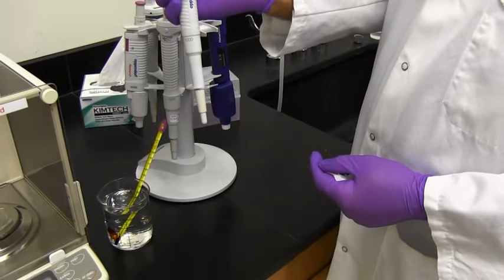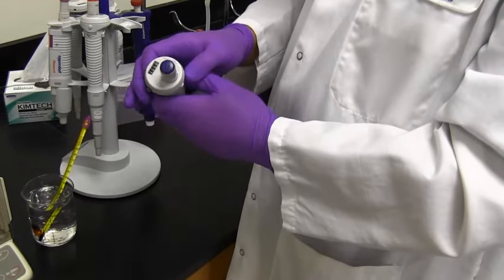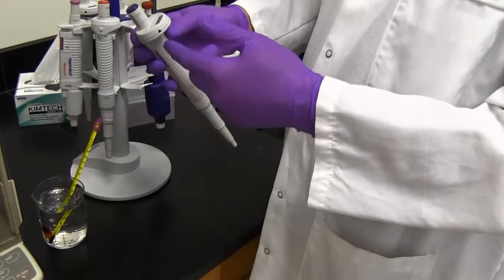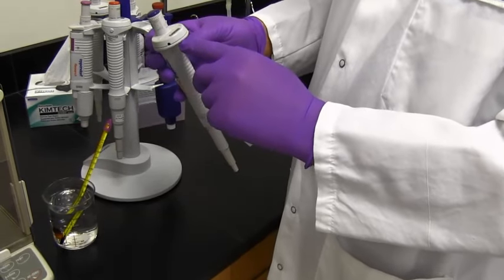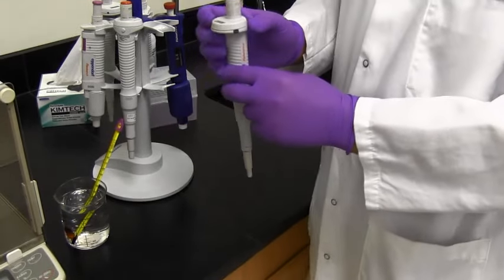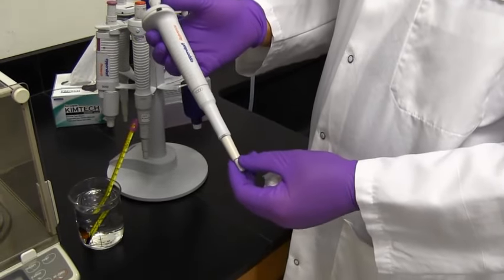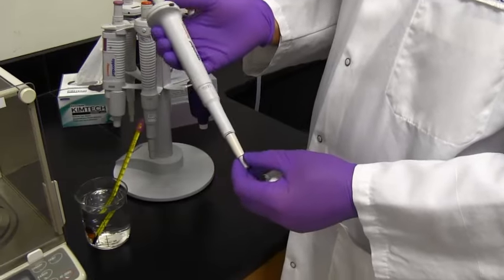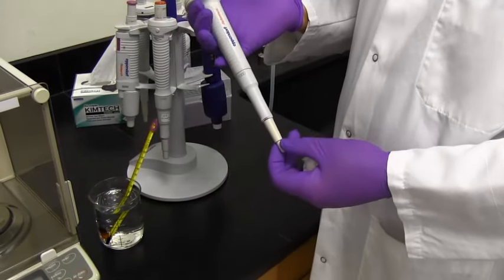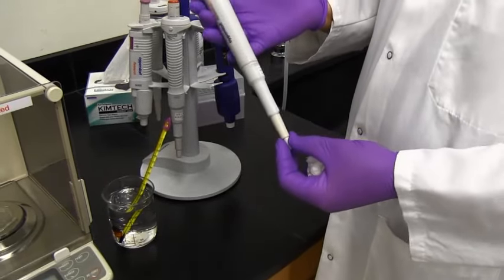It's loose. So it's got enough lubrication on the o-ring. Otherwise I have to lubricate more. Before calibration I got to see if I need any adjustment. There is a knob for adjustment. I can use the knob. I can turn it clockwise or the other way around to get it to the calibration weight I needed. I usually like to 100% accuracy. But our spreadsheet allows 5% deviation. For some methods, clean water act, use 2%. For macros it's 2.5 or 3%. It depends on your QA program, what percentage. The tighter the accuracy, the 1% is the most accurate one.